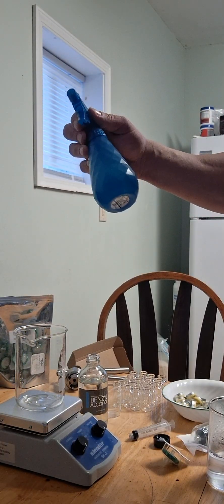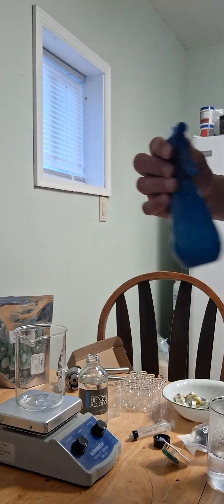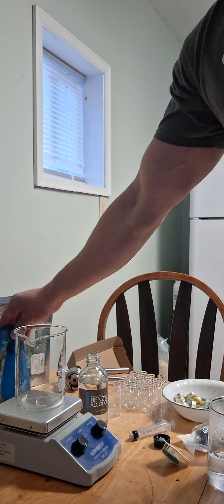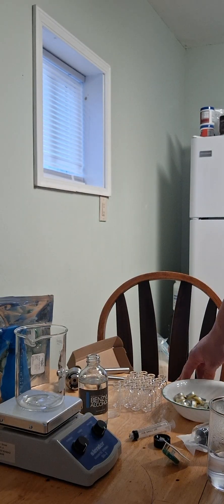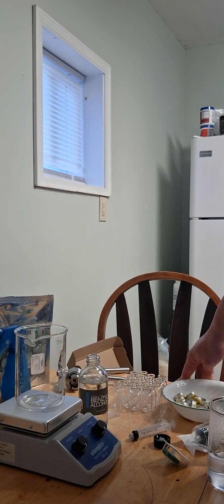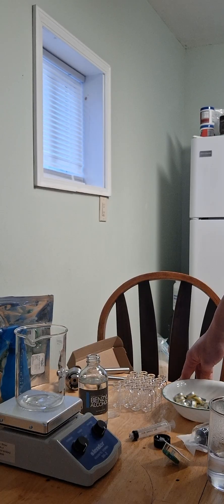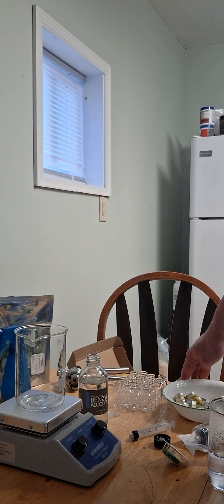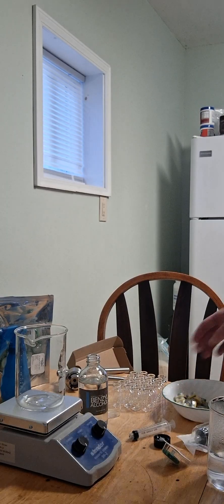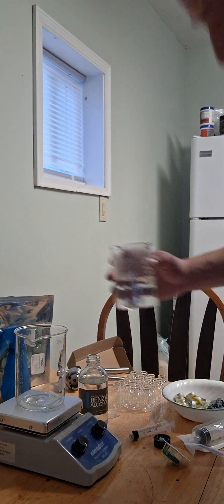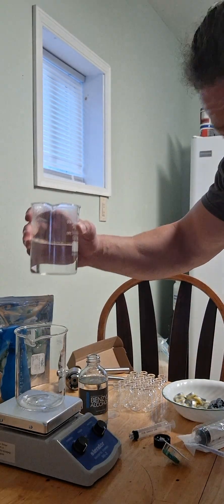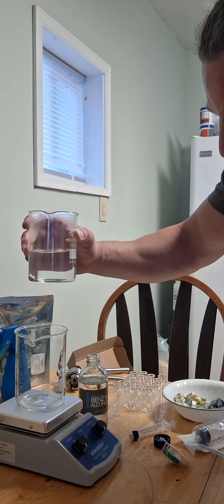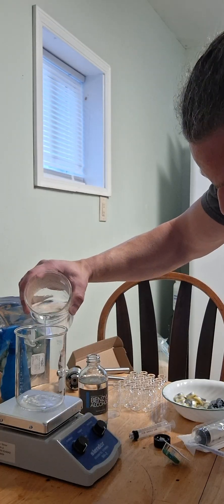I use isopropyl alcohol 70% to just kind of spray my hands and arms down. You want 70%; you would think that 90% would be more sterilizing, but it evaporates too fast to kill off bacteria, so 70% works good. Or you can just use hand sanitizer; that would work too. Okay, so anyway, I added my BAC water. I'm going to fill this. Also, I boiled the distilled water just for extra safety measures.